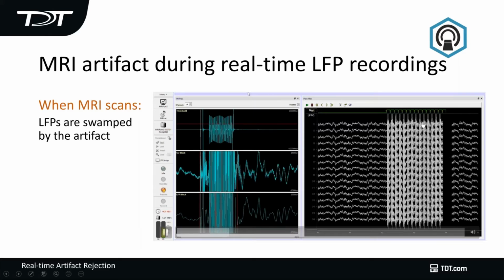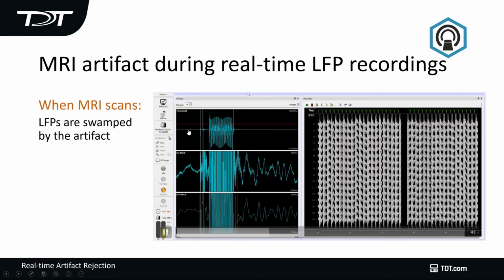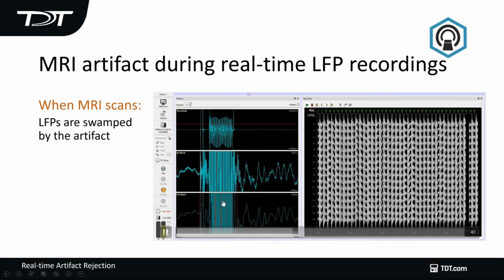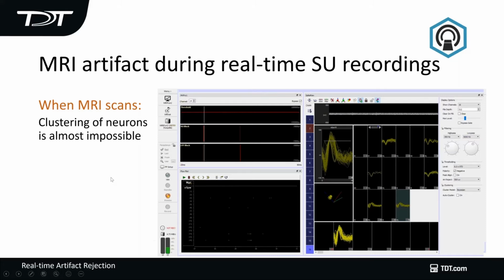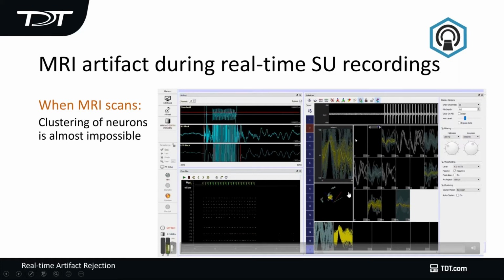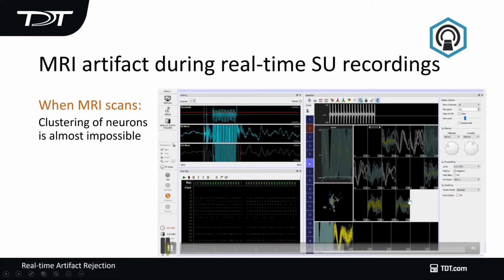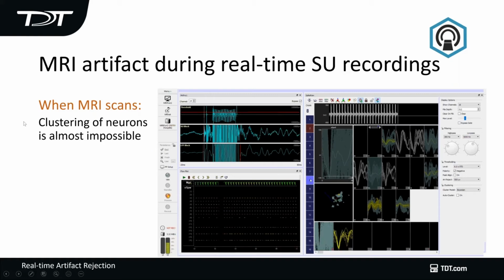You can see that you cannot really tell any of your local field potential signals while the artifact is on. Similarly, if you're doing spike sorting, you're not going to be able to detect spiking activity during your recording session. Here comes my artifact, and you can start to see that the signal characteristics become significantly distorted, and it makes it unable to do any analysis of your signal.